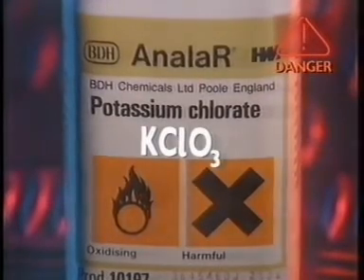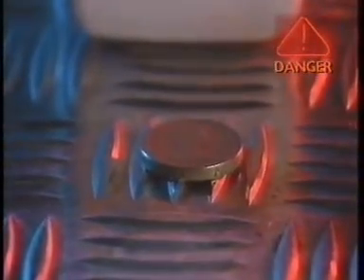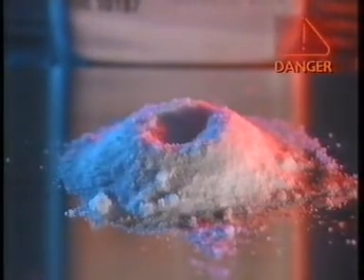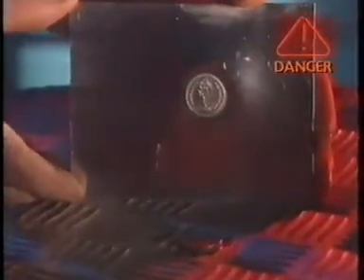Potassium chlorate is a strong oxidizing agent. It's got lots of oxygen in it. You'll see the point of the coin later. The white substance is the potassium chlorate. Phosphorus dissolved in a liquid is added. When it's touched with a hot metal rod, during the flash, the phosphorus was oxidized by the potassium chlorate. The reaction was so ferocious, it was as if the metal plate had been hit by a sledgehammer.